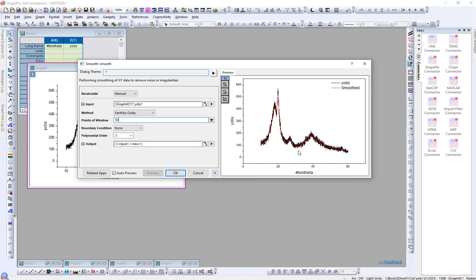Yeah, it's much better. One thing you have to pay attention to is that for these peaks, the red line should be exactly on the black lines, and you should not miss or displace the peaks. So I will show you. Let's jump to a very high value like 250. Let's see how it looks.